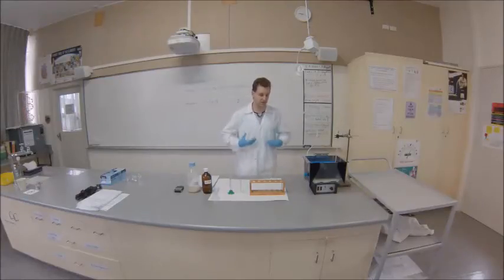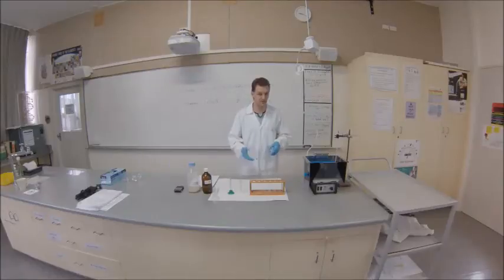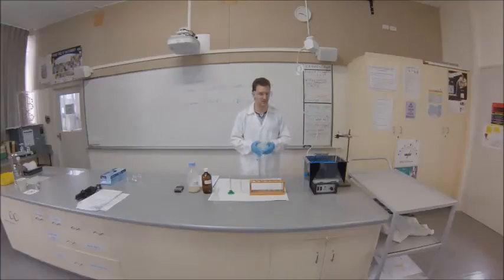In this case, I'm wearing a full lab coat - you'll have an apron. We've got gloves and safety glasses. Those are the basics we always have for every experiment, so it's a good habit to be in.